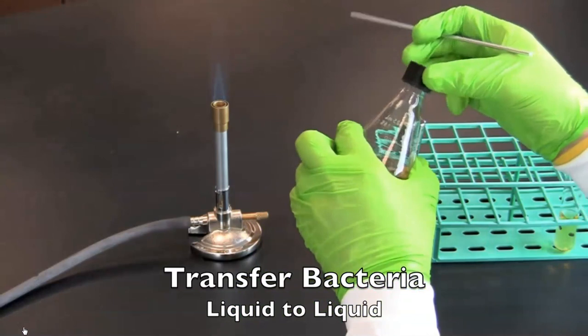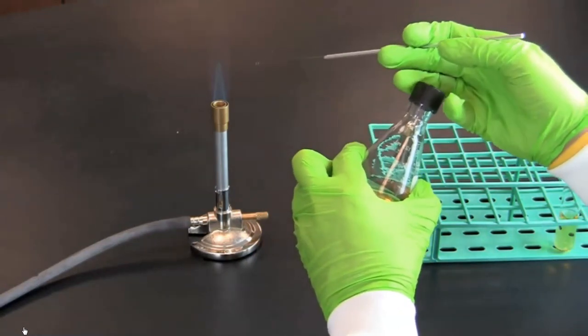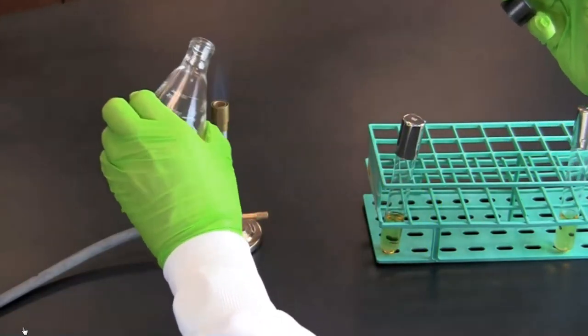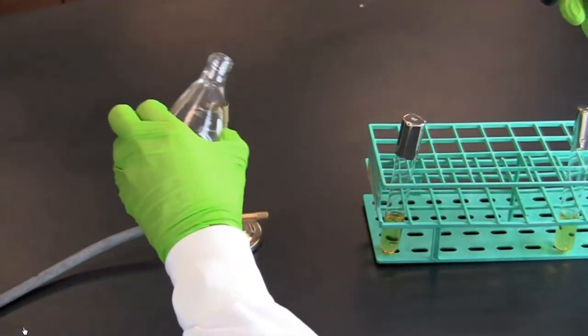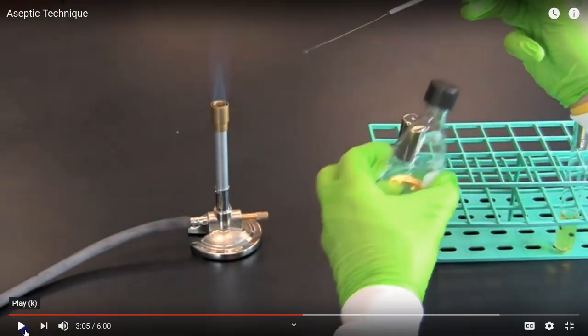In this section, you will learn how to transfer bacteria from a liquid culture to a liquid. After sterilizing an inoculation loop, take the lid off the container of liquid culture and pass the mouth through the flame. Then dip the loop into the liquid culture and flame the mouth again before replacing the lid. Why do you think it's important to flame the mouth of the bottle?